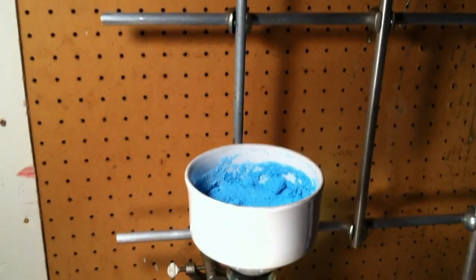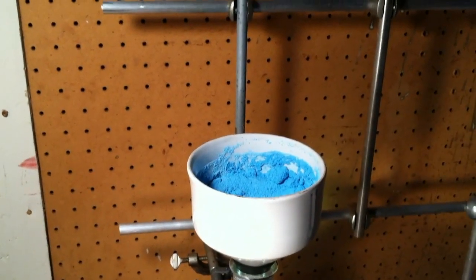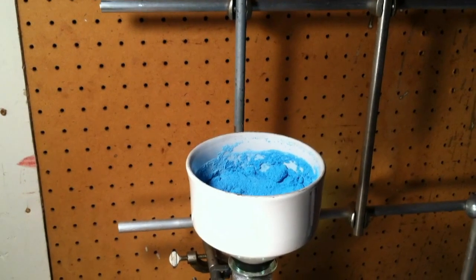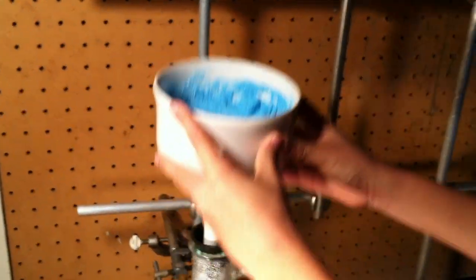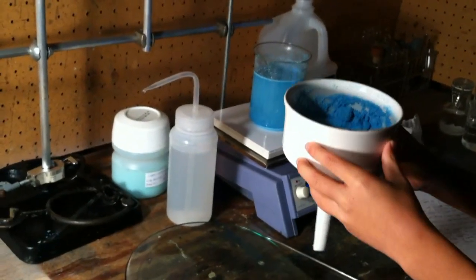The copper benzoate is now dry. Remove it from the vacuum filter and place it into a large dish.